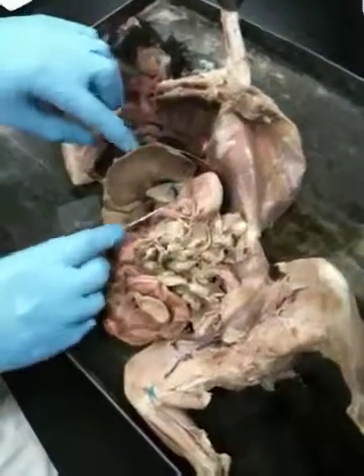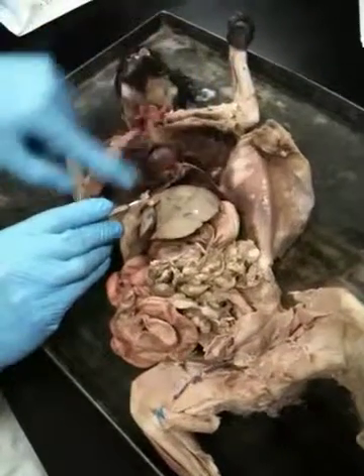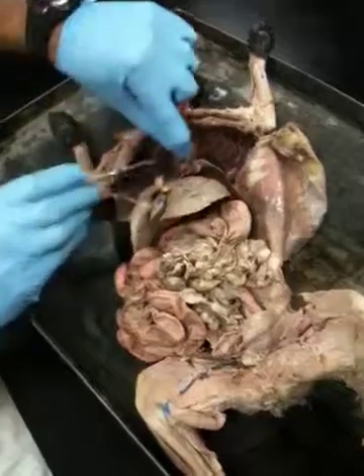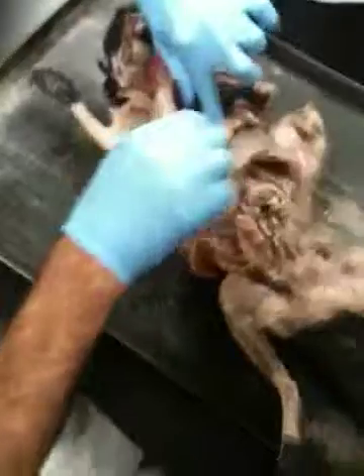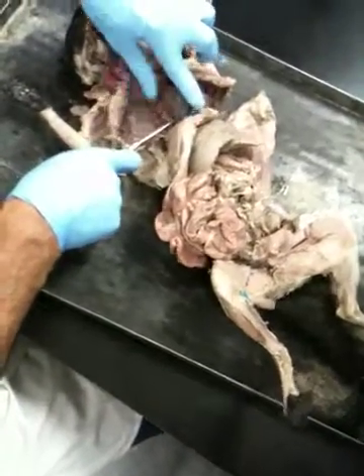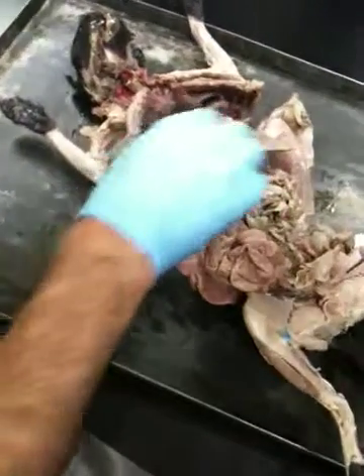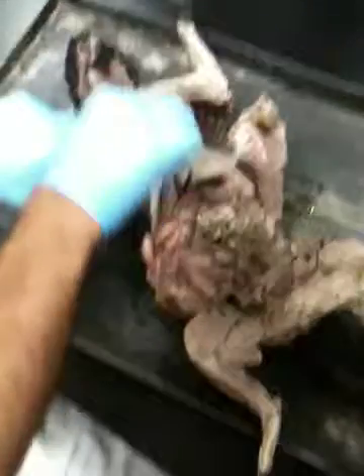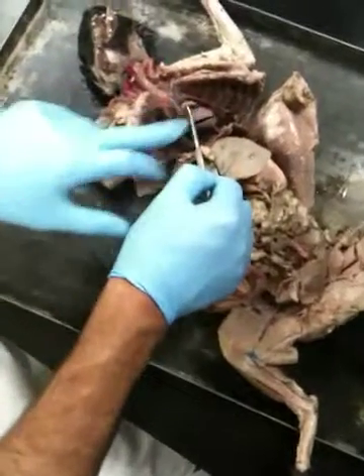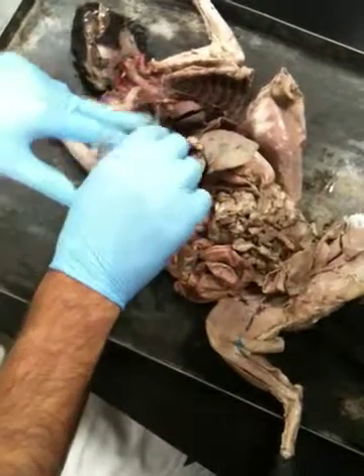Okay? So then we can go over here and see the inferior vena cava right there. Okay? And if you push all of these aside, you're probably going to be able to see the azygos right there. Azygos vein. Here is the superior vena cava. Here is the heart. We covered and cut probably the serosa, pericardium, and all that right there. Okay, those are the pericardium. Remember the epicardium we talked about, and so on.